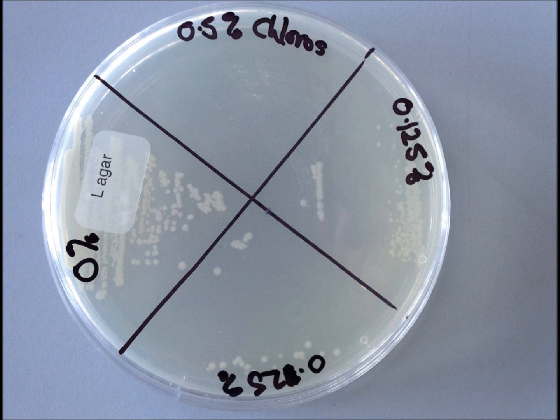And that's what I've done here. I've taken a loop full from the 0% Chloros and you can see that after 24 hours there's a lot of growth there, that's what you'd expect. I've also taken a loop full from the 0.25% and the 0.125% and you can see that you get growth there as well.